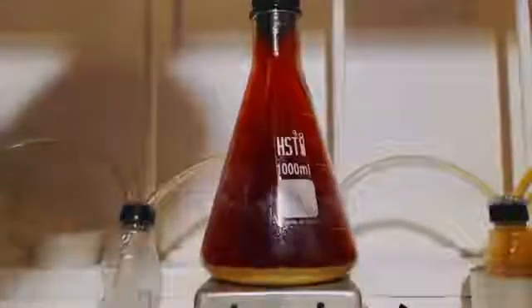That's the last bottle. First bottle. Second bottle. Third bottle. The last bottle, you can see it's starting to get a little murky, but still the gas hasn't got to that bottle yet. So I know I'm scrubbing pretty good. I got it up to where I'm shaking it, and I don't hear any metal hitting the sides of the glass. So I'm guessing that's about it. I'm going to throw another bar in there.